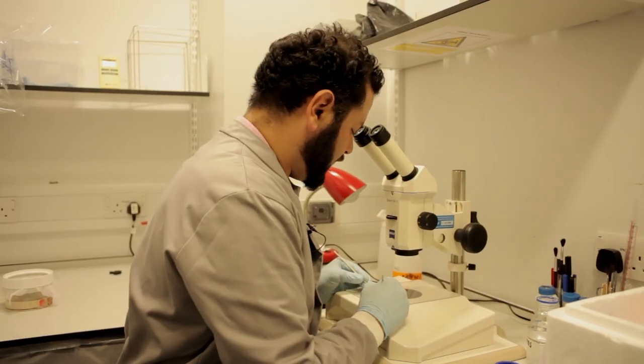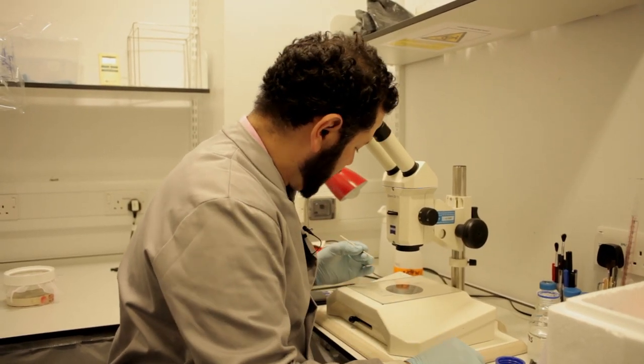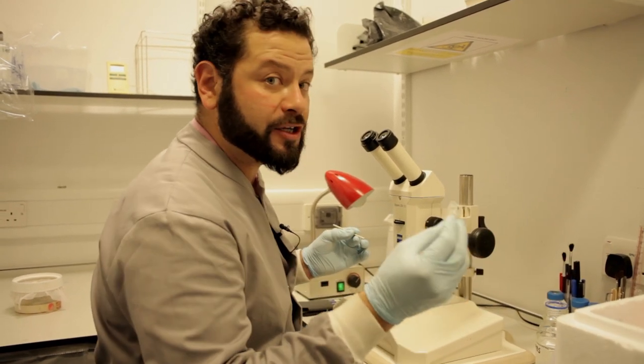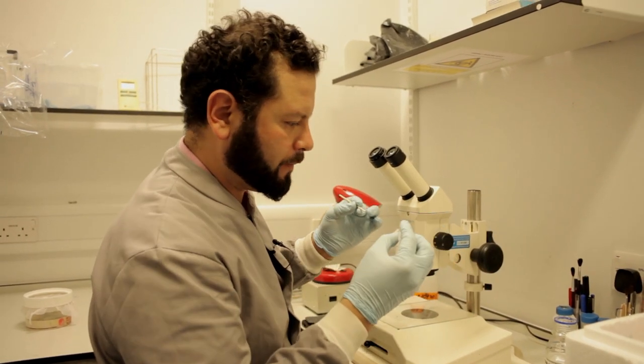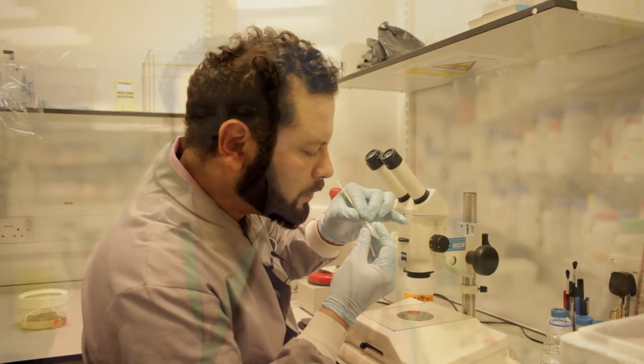Once the mid-gut is free, use your needle to transfer it to wherever you need. I place mine in small tubes. Once we have collected the sand fly gut, we can perform different experiments with this tissue. Some researchers do this with wild-caught sand flies and look for leishmania parasites.